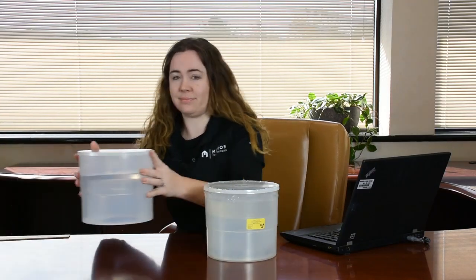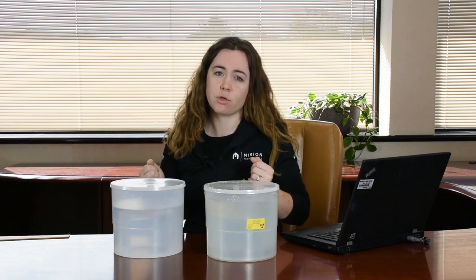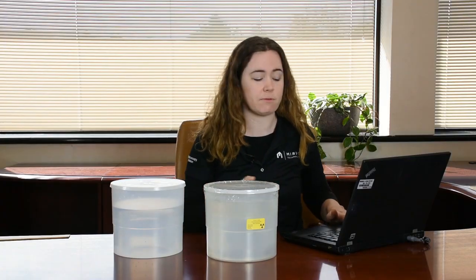My hope is that this video will help you determine if LabSOCS variable geometry is of use to you in your operations. Let's take an example first. Here is a standard Mirion 4-liter calibration standard, which you may have calibrated in your system. However, you are provided a sample like this, which was not filled to the same level as your calibration standard. What options are available? Well, let me show you what one of those is, the new LabSOCS variable geometry.